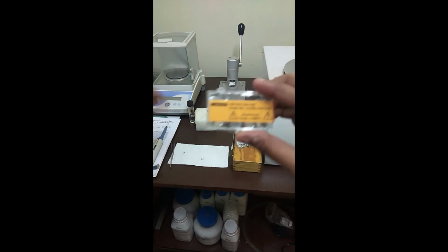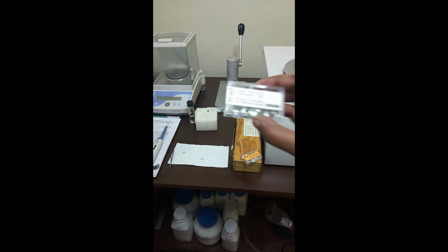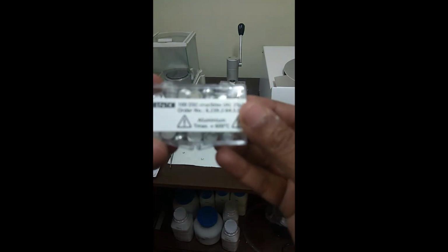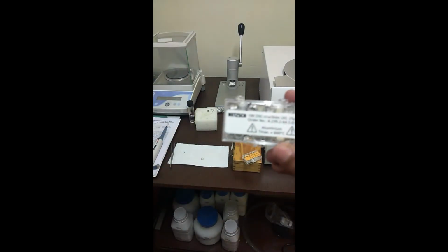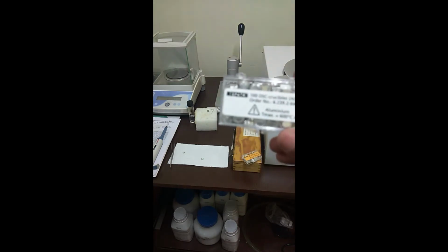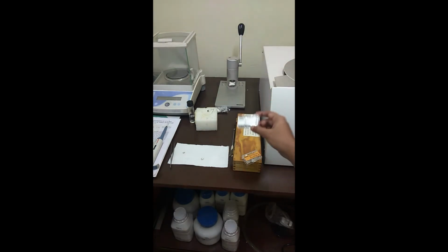So this particular is the lid of the pan, the DSC lid of the pan, and then there's a crucible which is again the same aluminium, and we load the sample in this aluminium crucible and cover it with a lid so that the sample doesn't spill inside the furnace. These are made up of aluminium, and similar to the instrument, the temperature range again here is from -60 to 600 degrees Celsius. So let's have a closer look at how this pan and the lid look like.